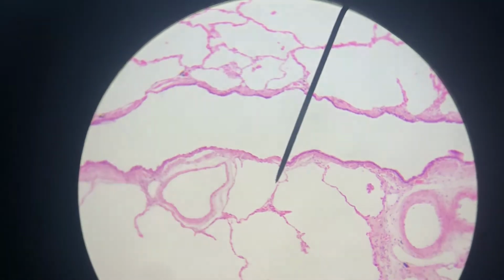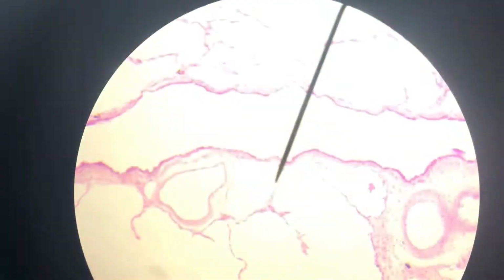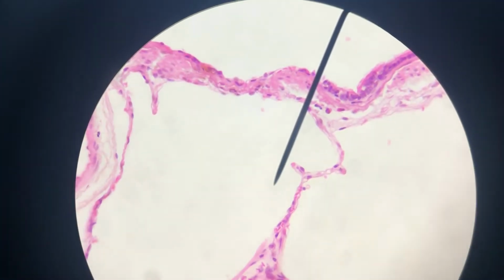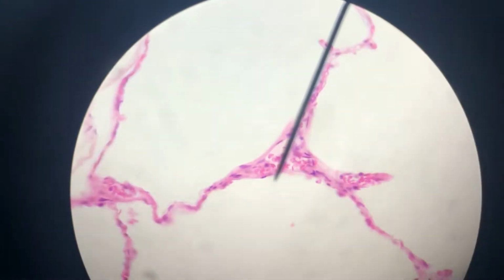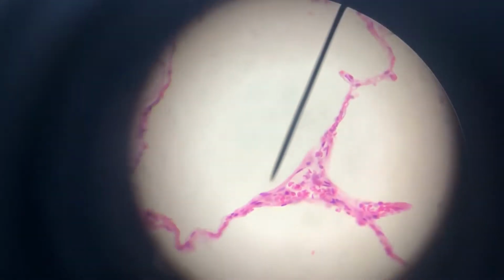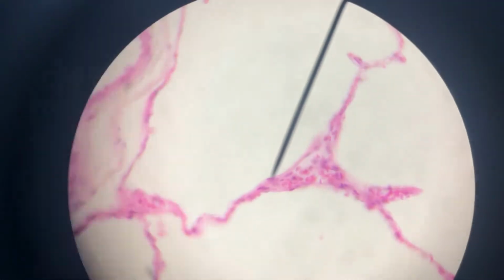Okay, this is simple squamous epithelial tissue that's easier to see. This is in the lungs. So the alveoli of the lungs are the air sacs across which we do gas exchange. Thinnest possible barrier in the body right here. So I'm gonna go to 40, and you can see that here. Look how beautiful. Each of these little purple spots is the nucleus of a cell. So this is hundreds of cells coming together to form this air sac in the lungs. That's simple squamous.